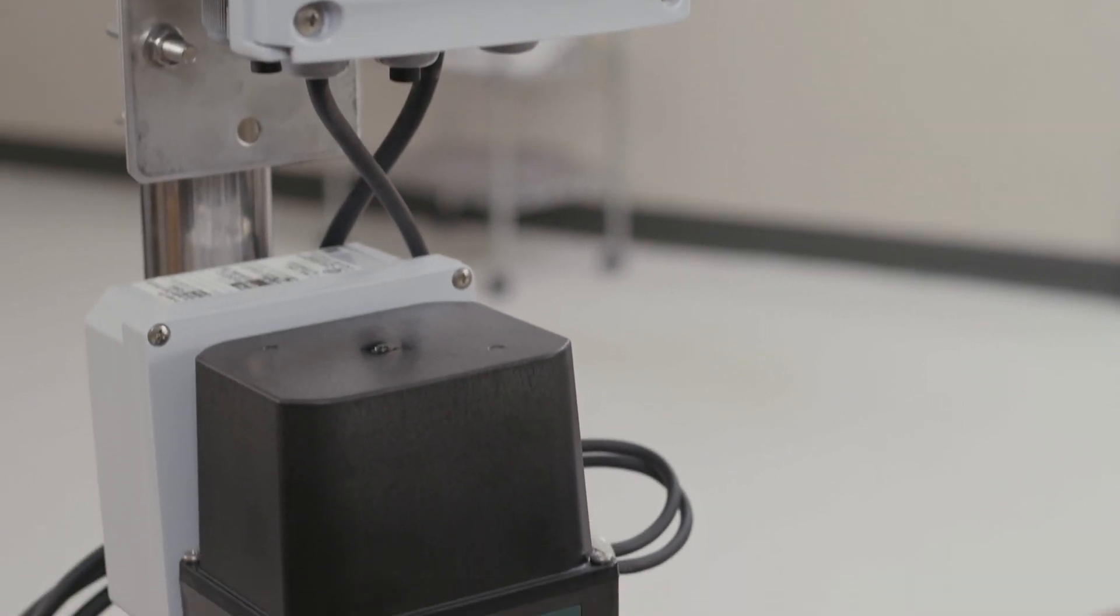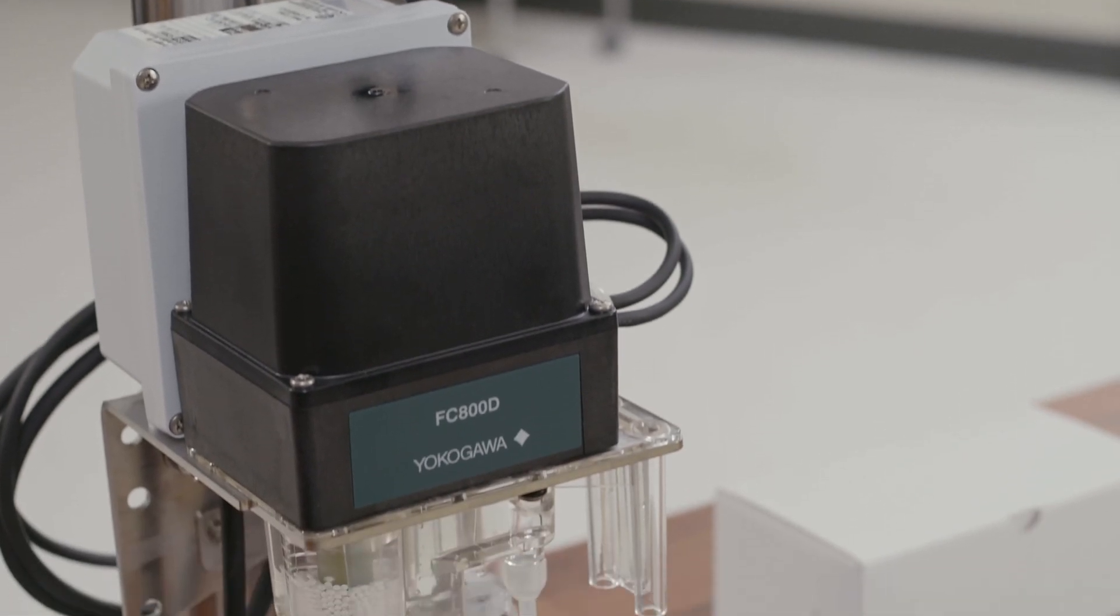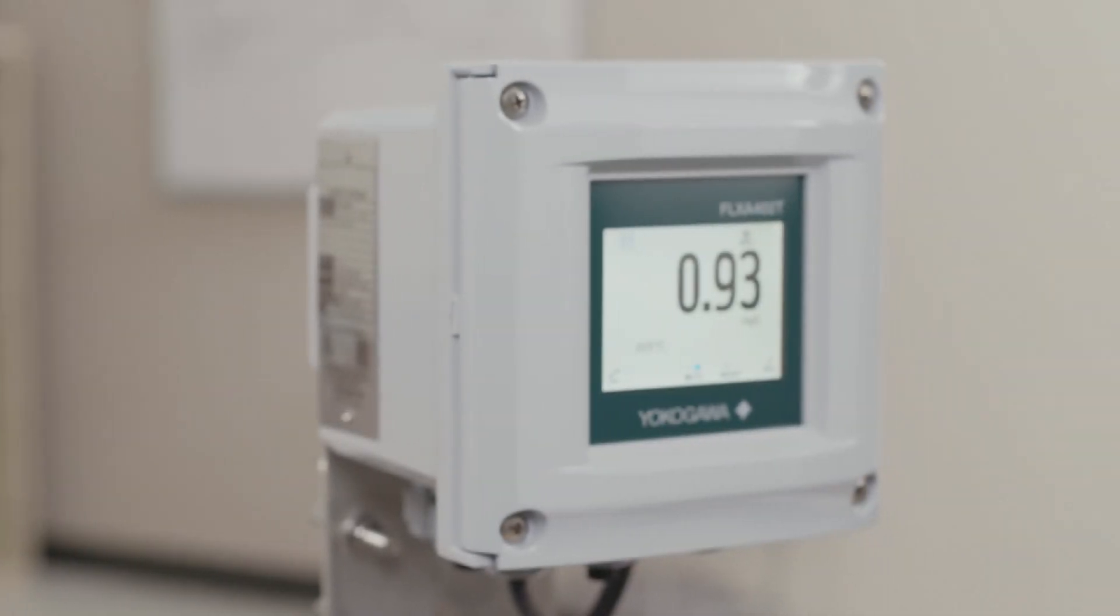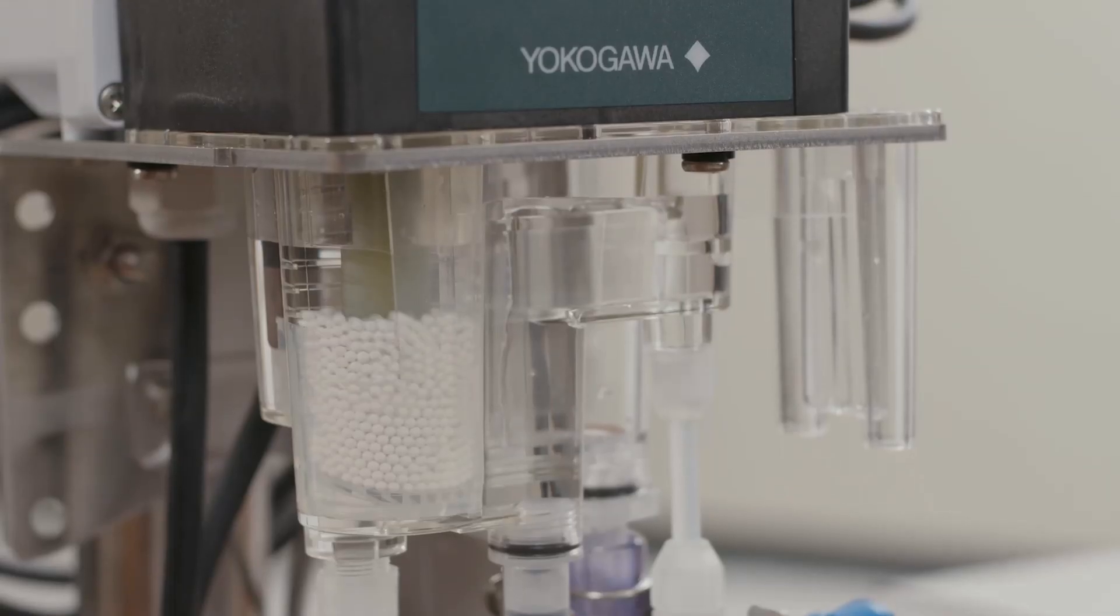First we're going to cover the zero calibration. As with most other analyzers, the zero calibration gets rid of background noise from the measurement circuit and gives you a good base for your measurement.